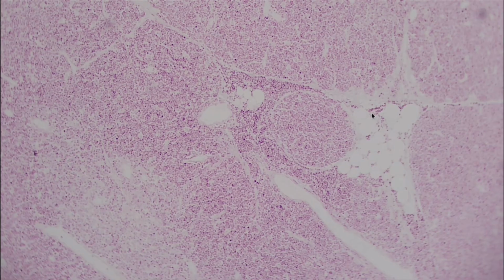And this is another big example of why I really emphasize coming into the lab, because this is also an example of reticular tissue. It's definitely different colors. Some people go off of color when they're studying, but that is not always your best friend, because the colors can really vary depending on how the slide was preserved and stained. So we really emphasize getting to know the structures rather than colors, because that can change on you.